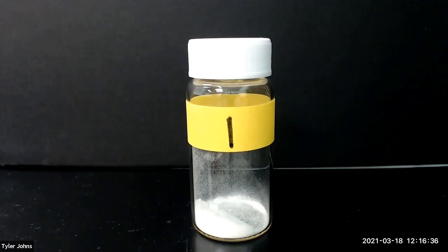Let's get started. You will need to determine the identity of unknown compound number one, and this is what unknown number one looks like.